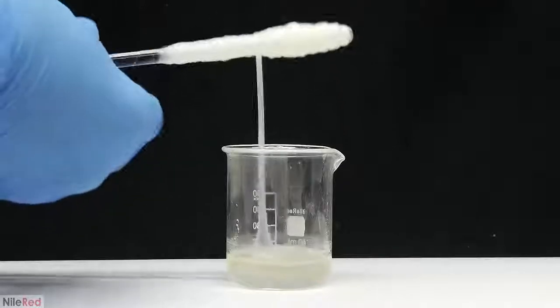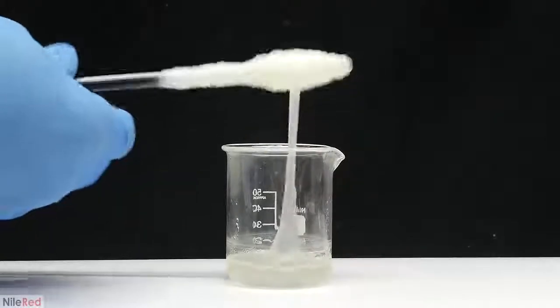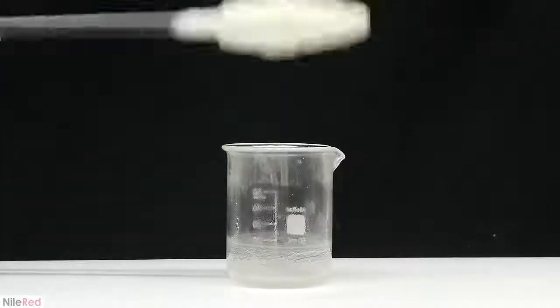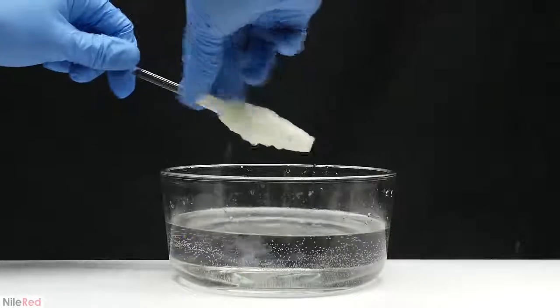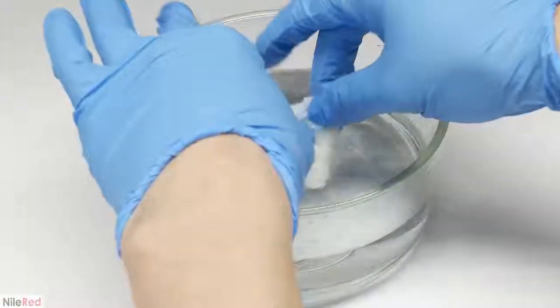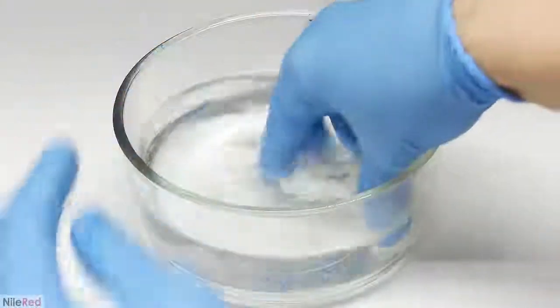It looks like there's a whole bunch of nylon here, but it's a little bit deceiving because it's being puffed up a lot by the water that's being pulled up with it. It eventually runs out of either the hexamethylene diamine or the adipoyl chloride. When I squish it with my fingers, you can see that there's a lot of liquid with the nylon. To try to clean it, I dump it all into a water bath. Without destroying the nylon, I manually pull it apart to try to give it a better washing. After about 30 seconds, I just leave it there to soak, and I move on to making more nylon.